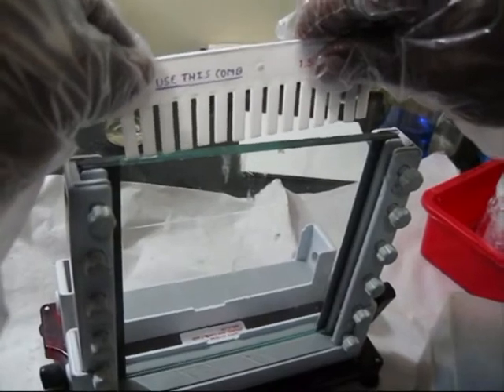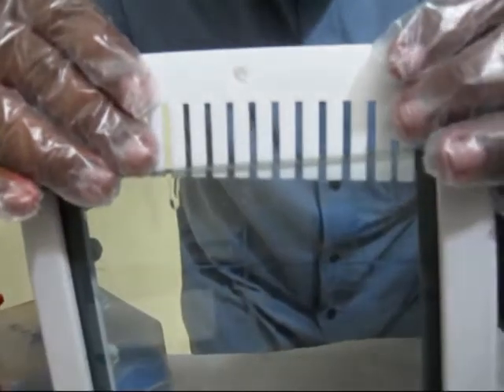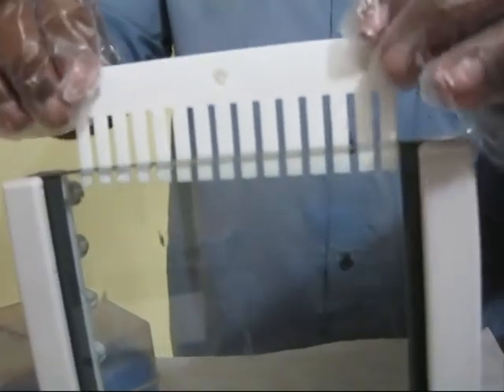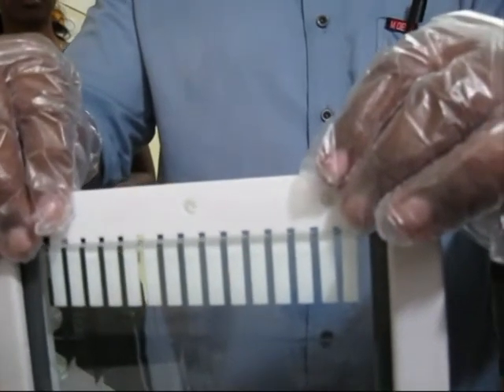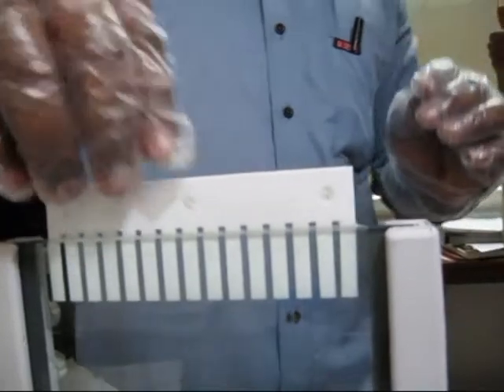Comb is gently inserted into the stacking gel. Care should be given while inserting the comb. The over spilled gel should be removed immediately. The number of wells varies depending upon the need.